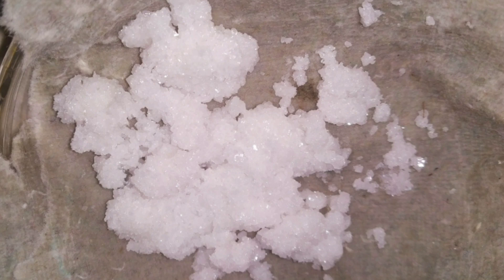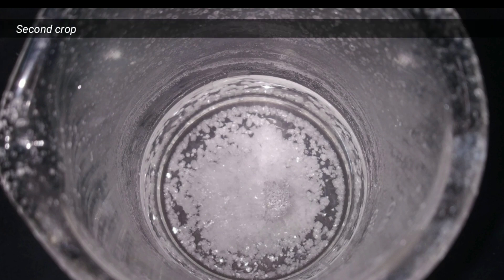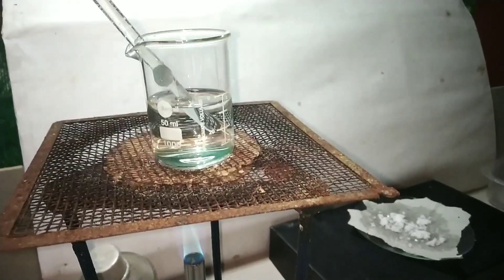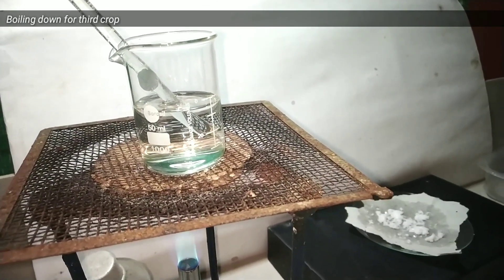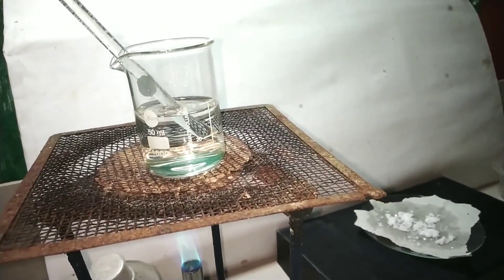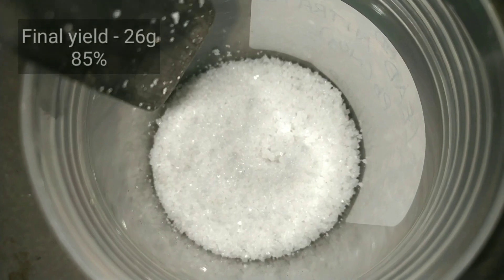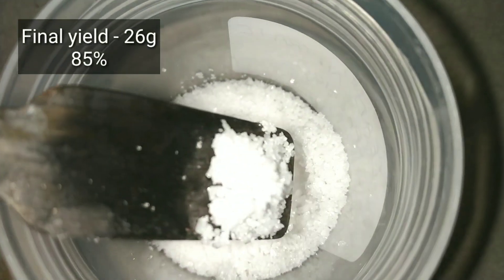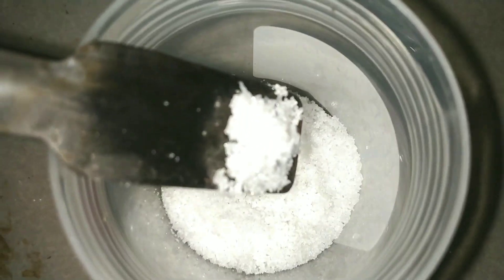I decided to boil down the mother liquor further and cool to obtain more crystals — this is the second crop. Yet again I did a third crystallization hoping to squeeze out every bit of salt. Finally I obtained 26 grams of lead(II) nitrate, which corresponds to a percent yield of 85%.